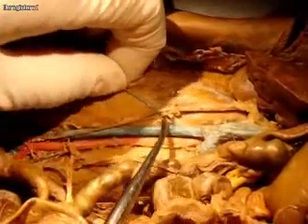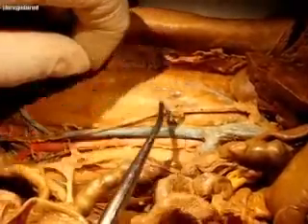Back to the kidney for a second — coming off of the kidneys, you also have the ureters. Here's a ureter coming down like this. And this might be part of the gonadal vein that's just broken off. The gonadal vein on this side actually comes out of the renal vein, but I don't see it here either.